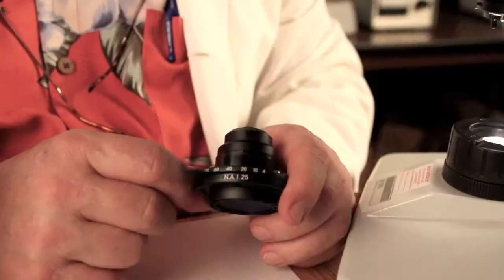So now I've put my condenser back on my microscope — the substage condenser. If your condenser does not come off, it's obviously easier to put your dark field stop on the bottom when you take it out of the microscope. If yours does not come off, just try to approximate it on there. Make sure that you're leaving a space around the opening for the light to come through to give you the dark field effect.